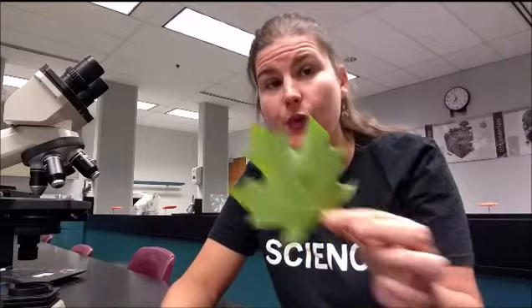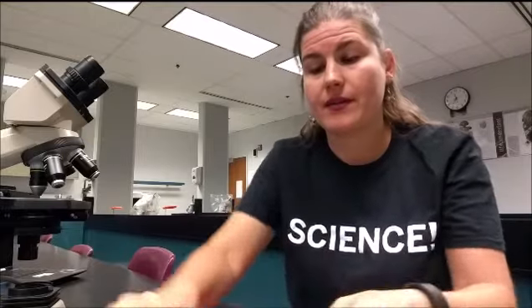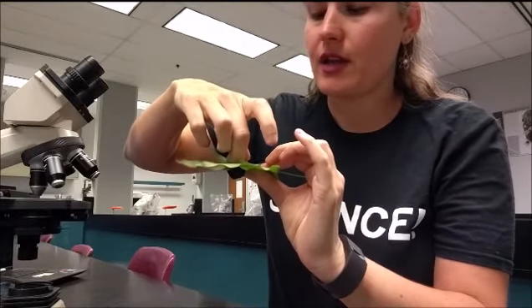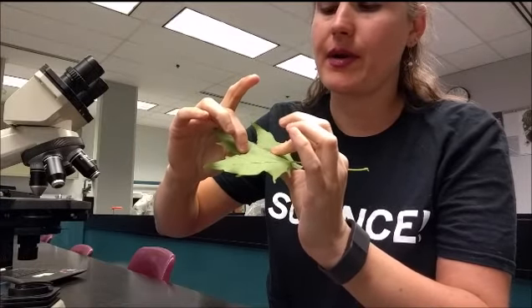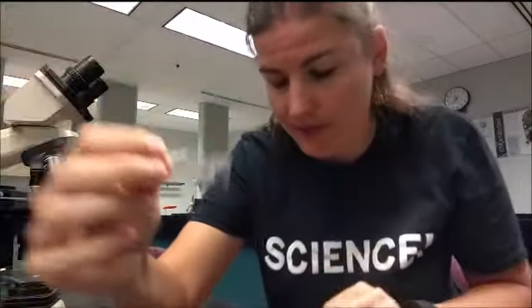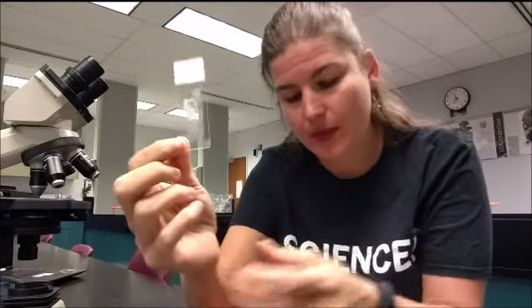So I went ahead and painted one before we started filming, and you can see there how it's nice and dry. And we're going to take a piece of gift wrapping tape, find our fingernail polish, and lay this piece of tape on there. Press it down so that it's against the fingernail polish. And then you're going to rip this tape off super fast like you're waxing eyebrows. Whip! And you can see that I transferred the fingernail polish and the leaf to the tape. And then we're going to take the tape and put it on the slide. And now we have our very own stomata peel.